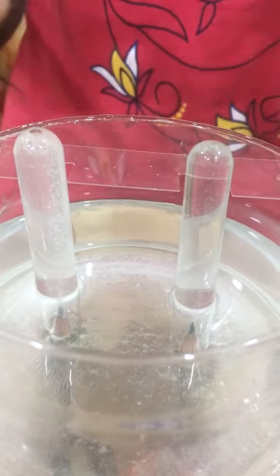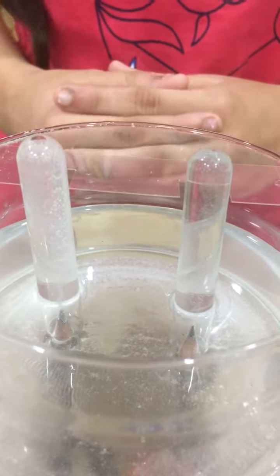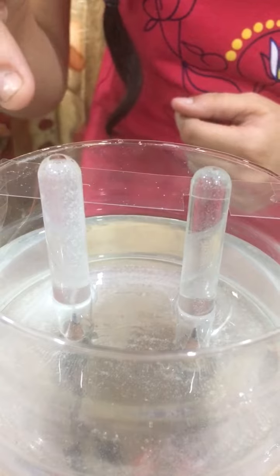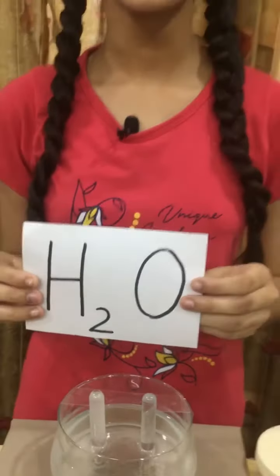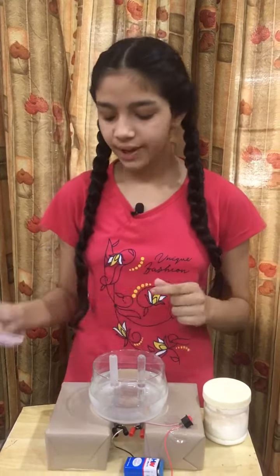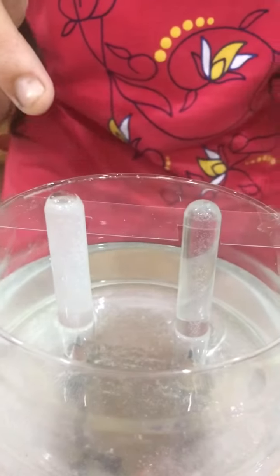This means electricity is passing through the water and is breaking it down into hydrogen and oxygen gas. But you can see here that in this test tube, there are more bubbles as compared to this one. This is due to the formula of water. The formula of water is H2O. In it, the ratio of hydrogen is double the ratio of oxygen. That is why in this test tube there are more bubbles as compared to this one.